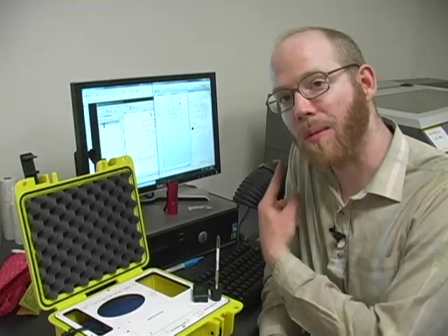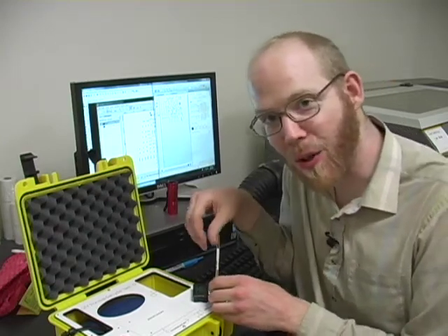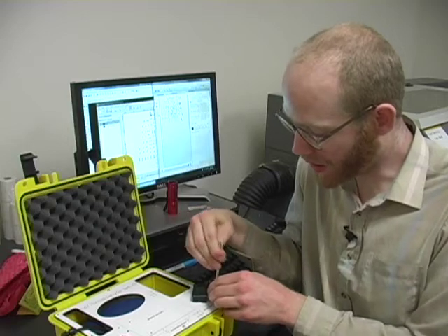Alright, so it's been a half hour. There's a laser cutter job that's been running the whole time in the background, so this is what operational conditions would have been like. I apologize for the noise. Let's take a look at the tube.